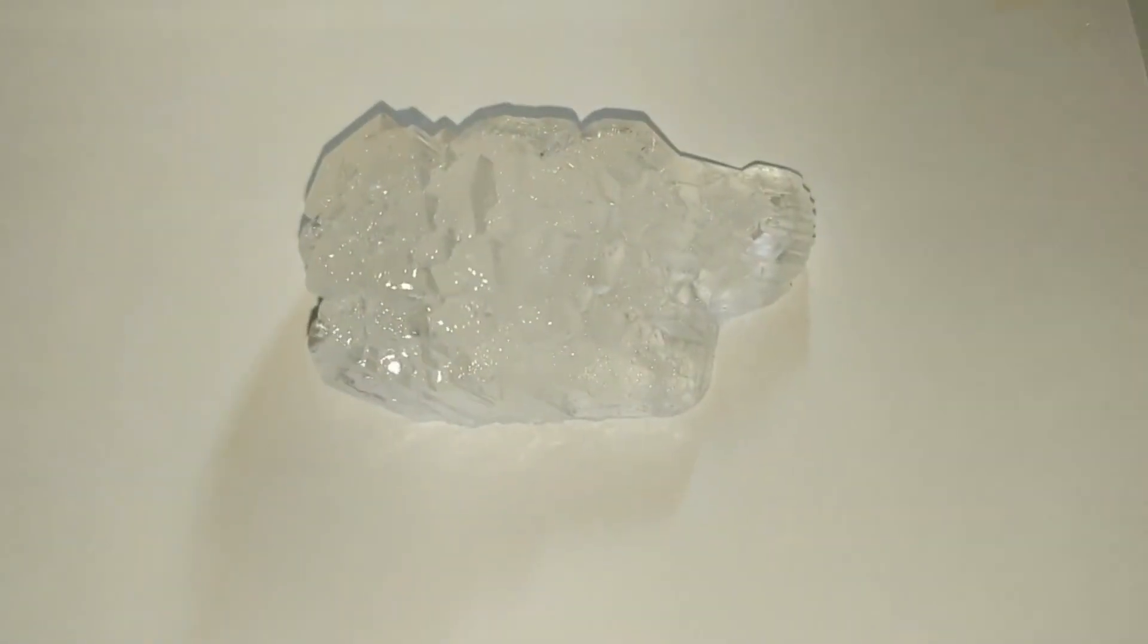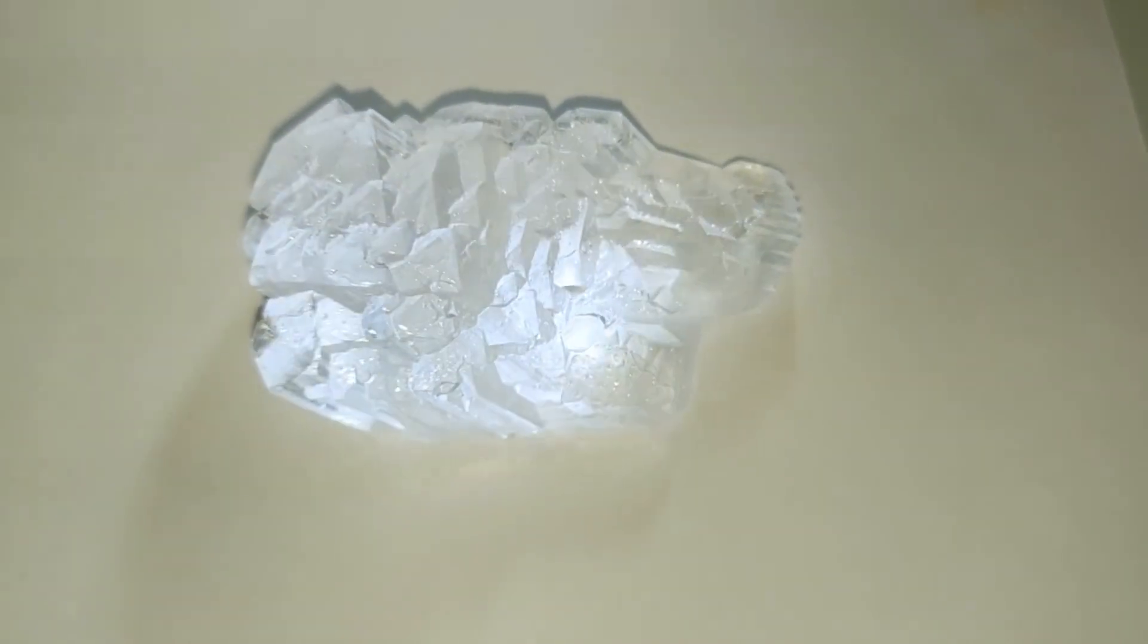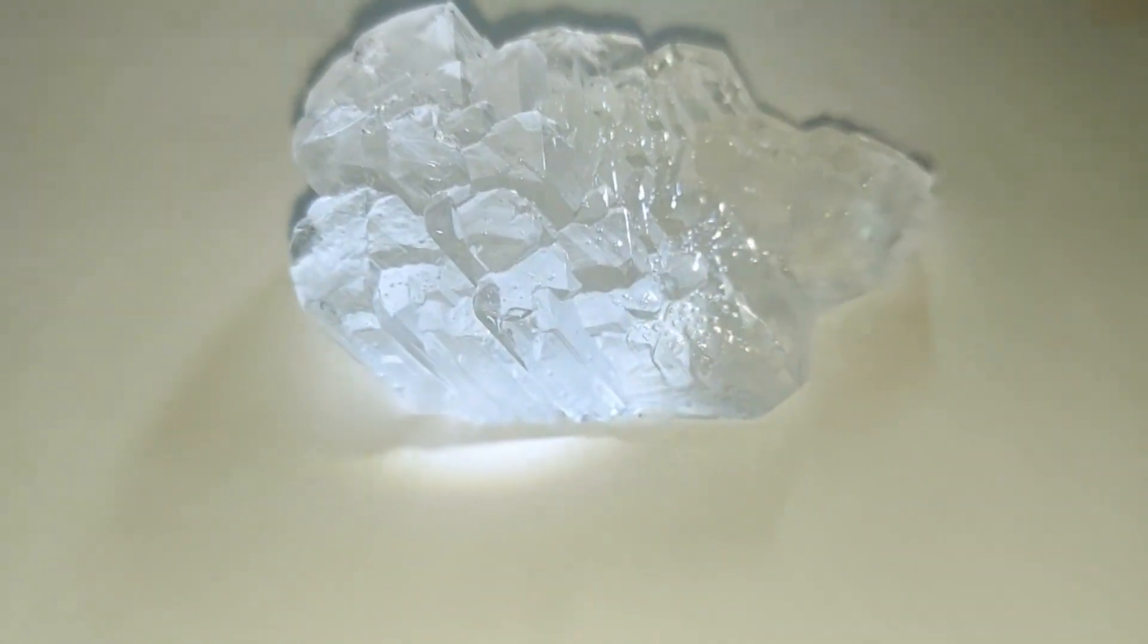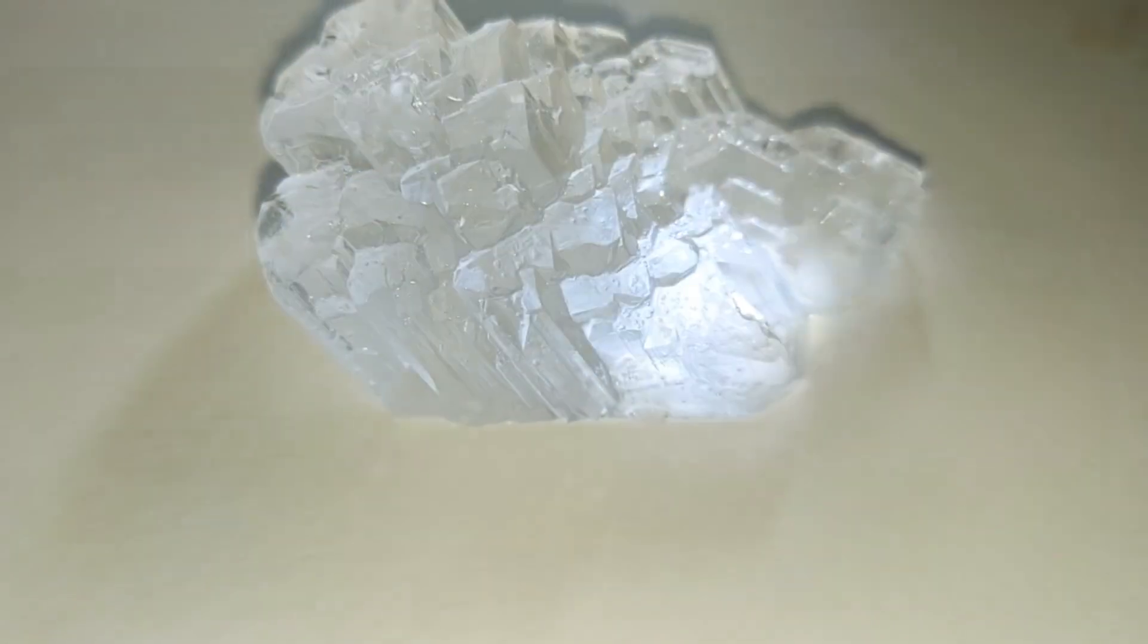I took the largest crystal out and this is it sitting here. It's remarkable, really. The crystal structure, obviously it's not water because ice doesn't look at all like this.